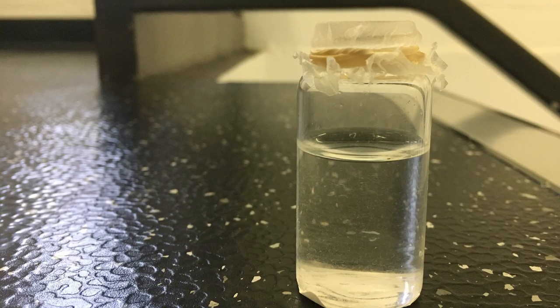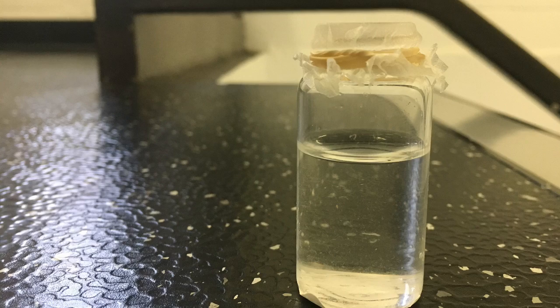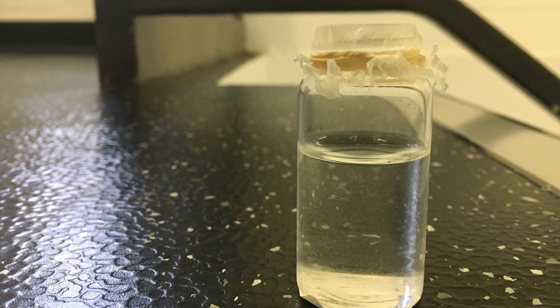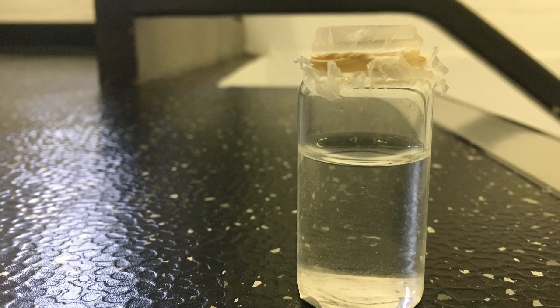This video is being filmed for the Northwestern Chemistry 182 class on the subject of obtaining alum from aluminum foil and recrystallizing it from a solution. Within the first part of this lab, we will discuss the synthesis of alum from aluminum foil.